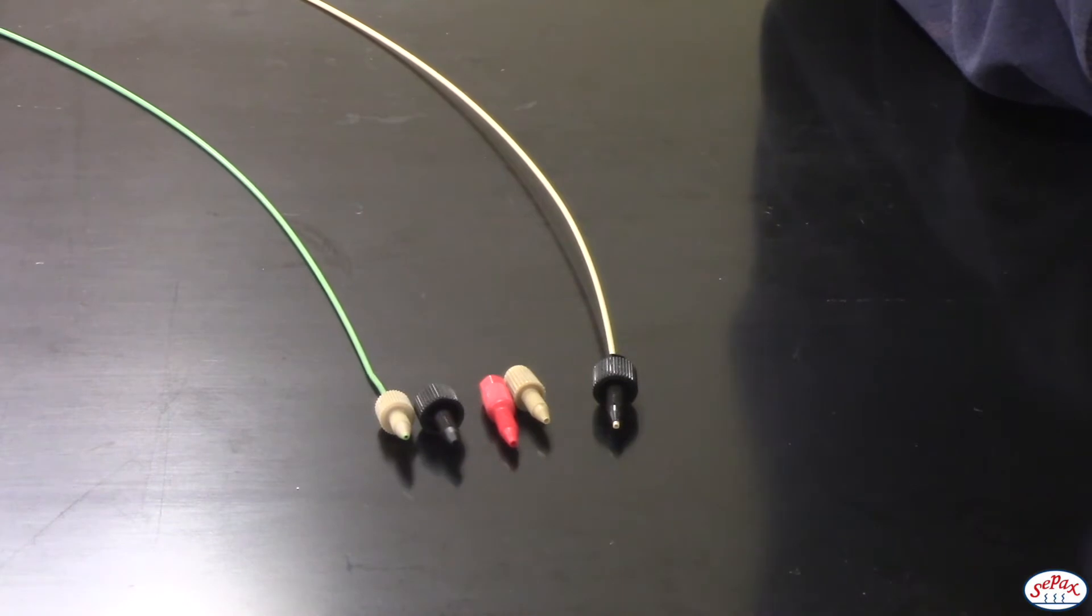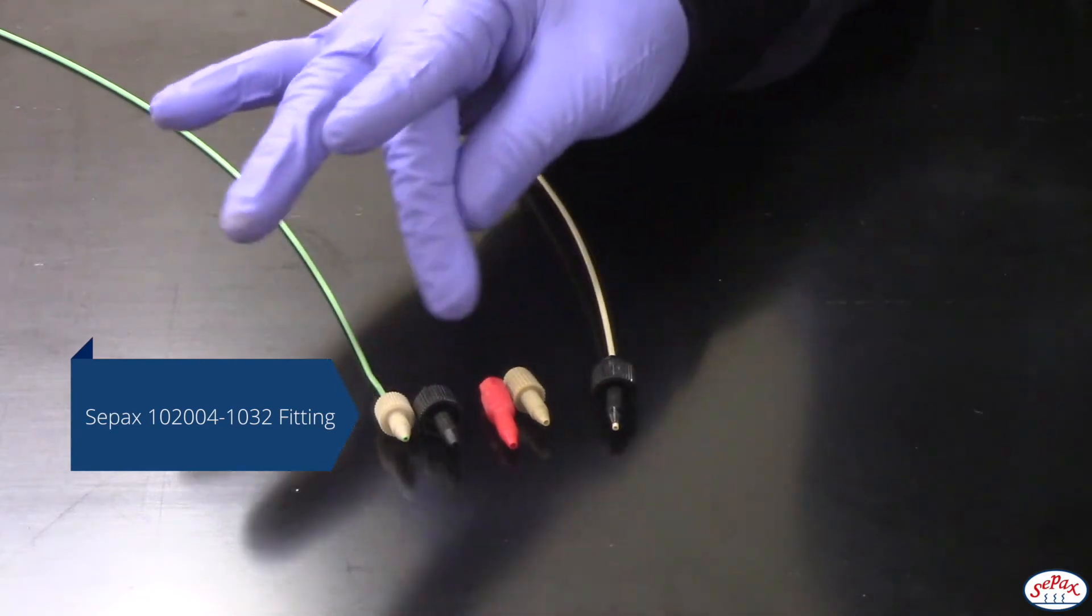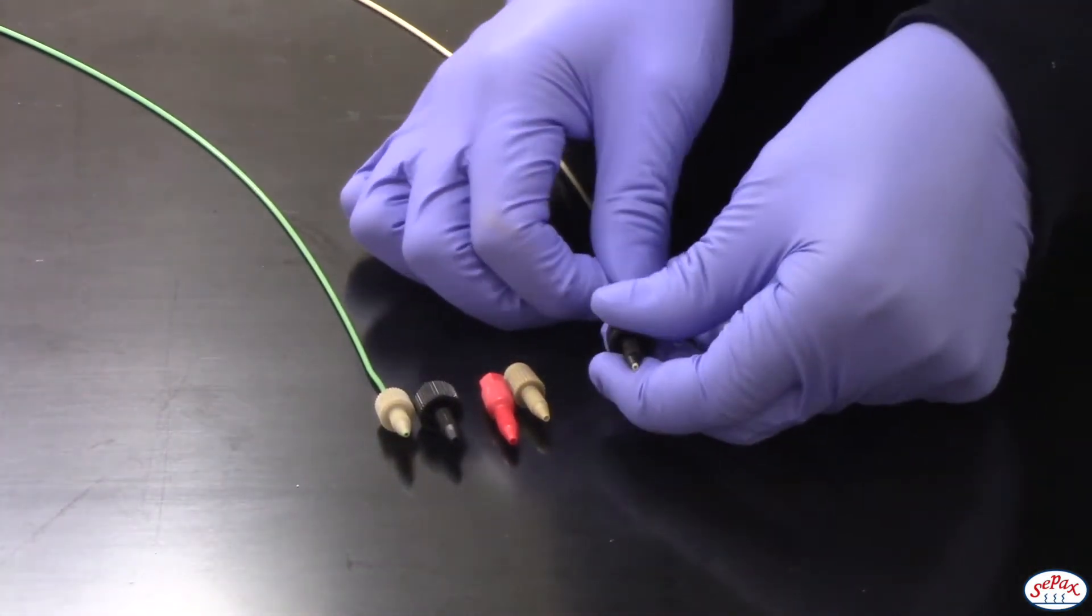Both of these, because the outer diameter is 1/16th, can fit into any of these fittings. All of these are interchangeable, and I can pop them off and change them as you can see here.